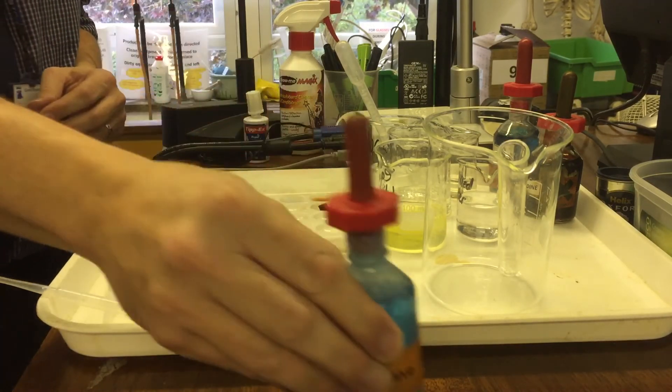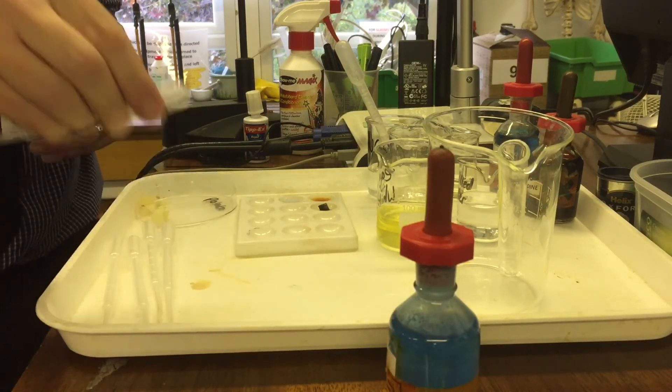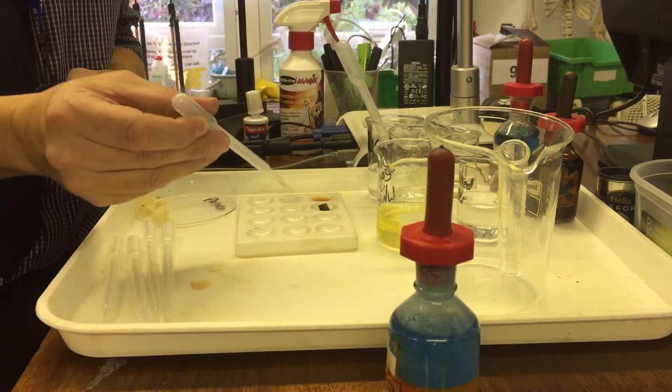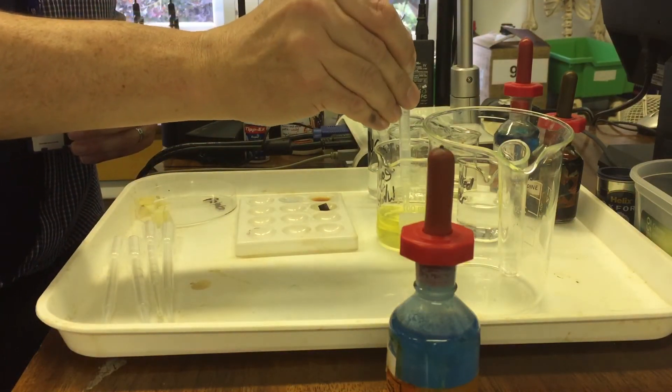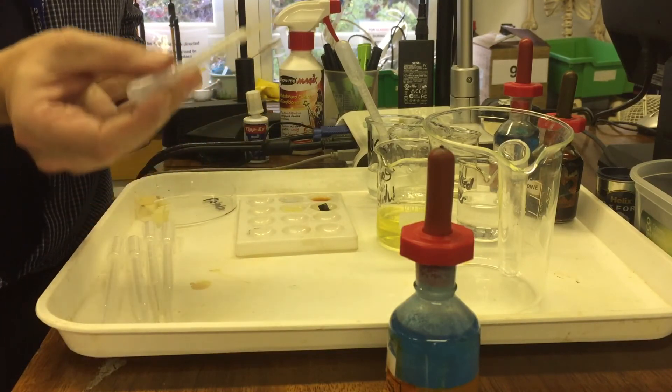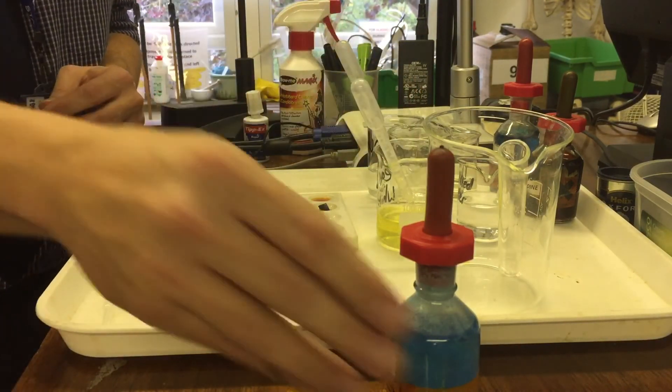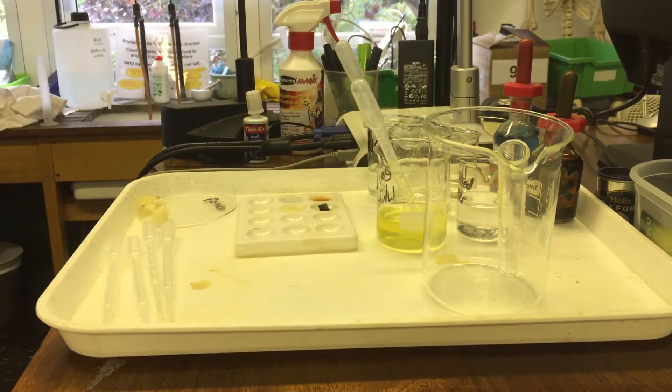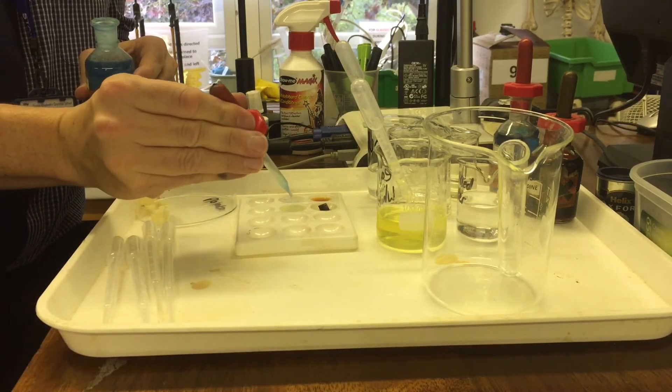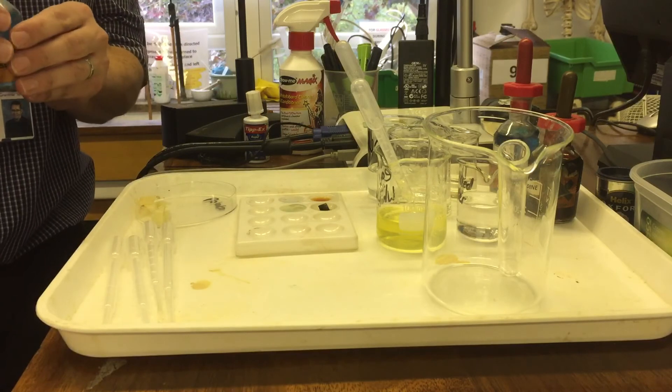But if I take something that contains a lot of protein, like egg white. Egg whites contain a lot of protein. And then take this reagent and add this. Give it a little while.